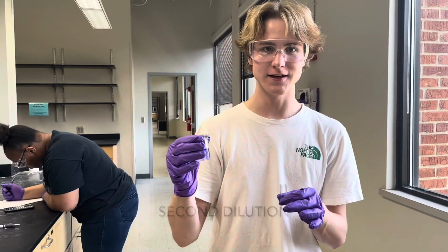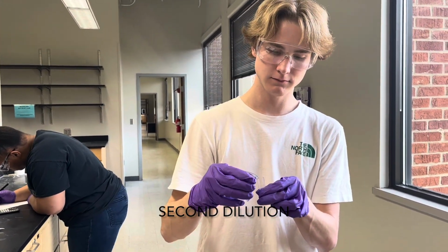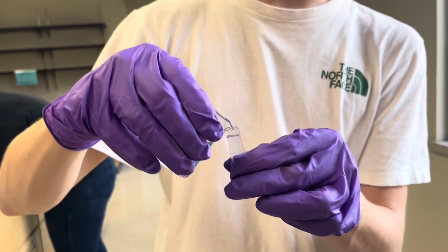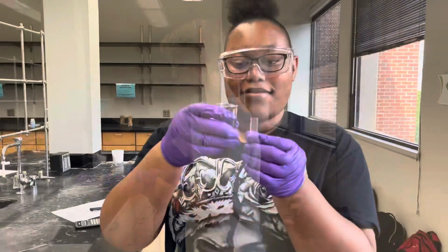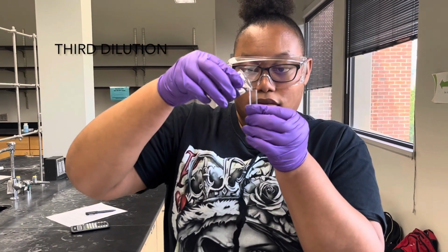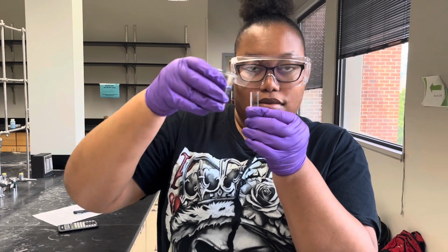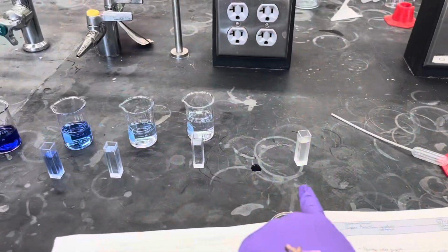I'm going to take our second dilution and pour it into our cuvette. And that's our third dilution. Ensure you have a blank when you go into the spectrometer.